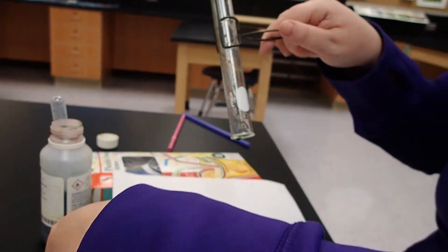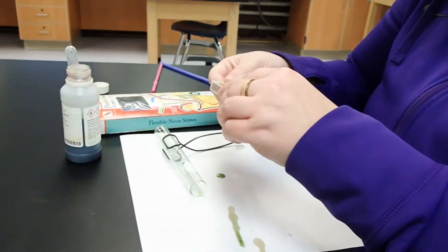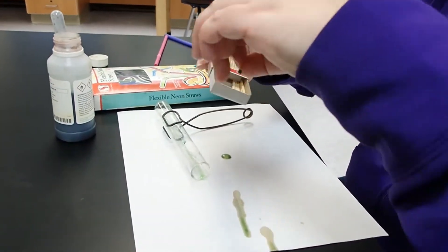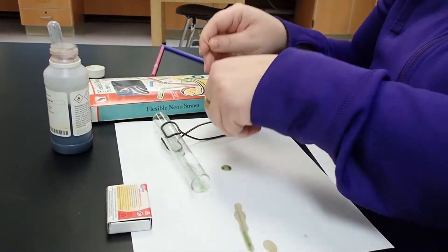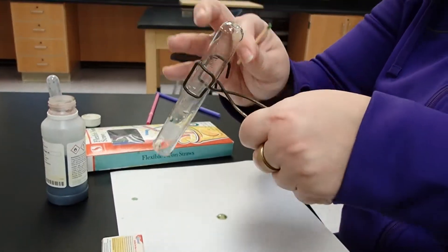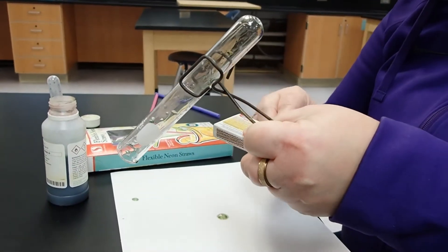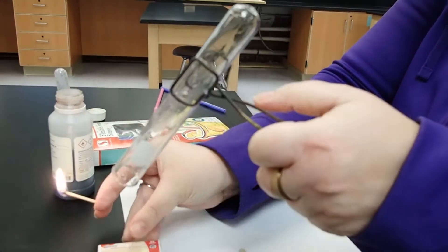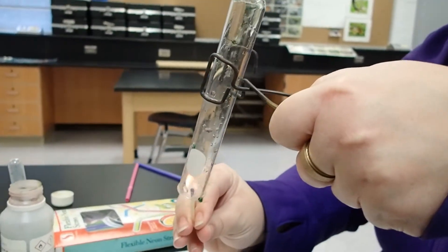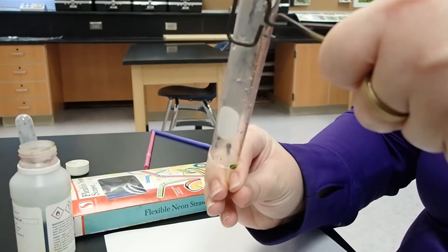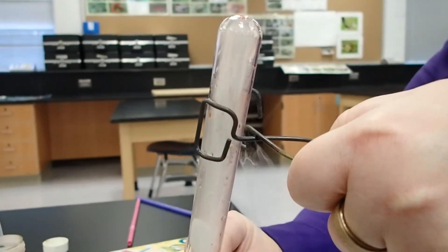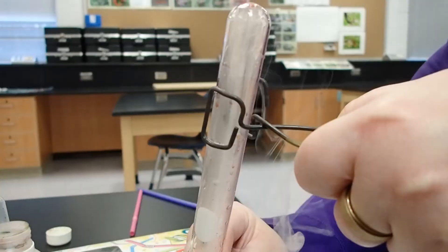Now I am going to very carefully light a match. Make sure my tube is ready to go. And take my match. You should see that smoke curling out.